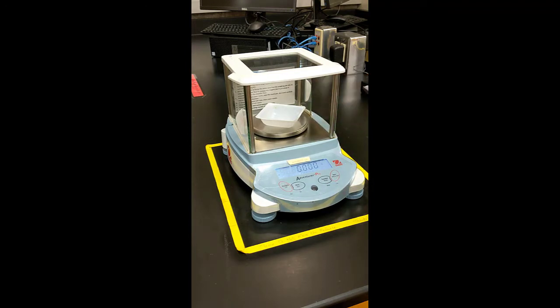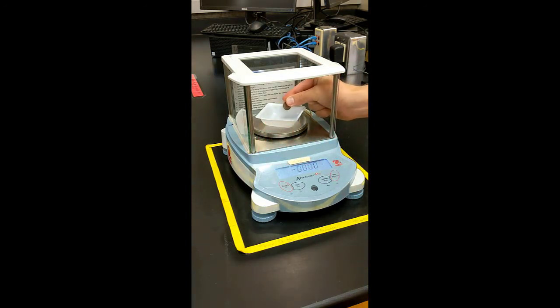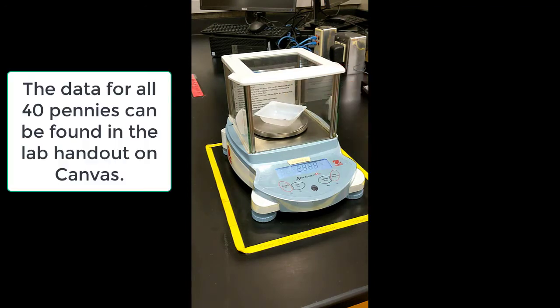From there, you want to grab a penny out of your beaker, record the year in your notebook, and then place the penny on your scale. You want to do this for each penny, recording all of the digits that you see on the scale. This goes much faster if you have a partner helping you along the way.